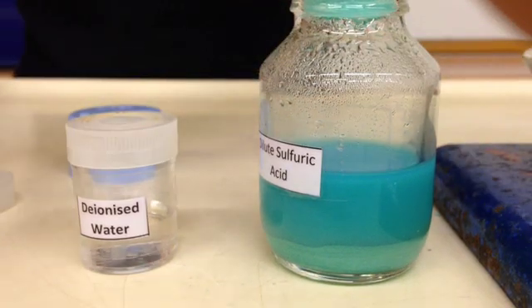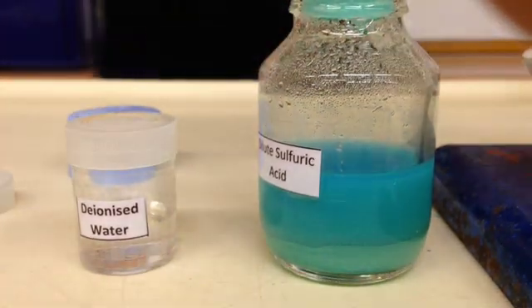So what I'm going to do is I'm just going to leave it to settle down first and we'll come to the next part and prepare for the next part which is filtration.